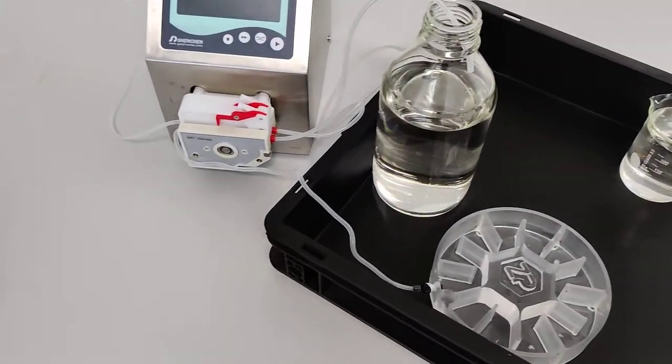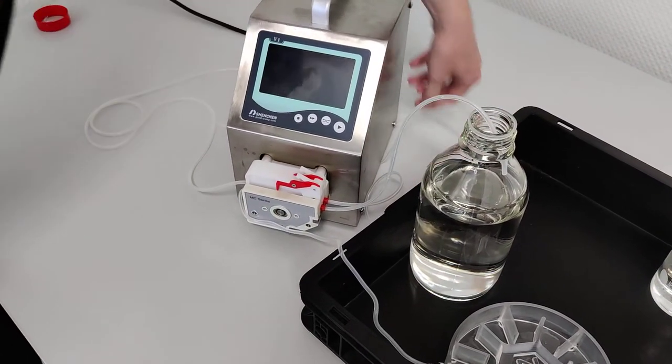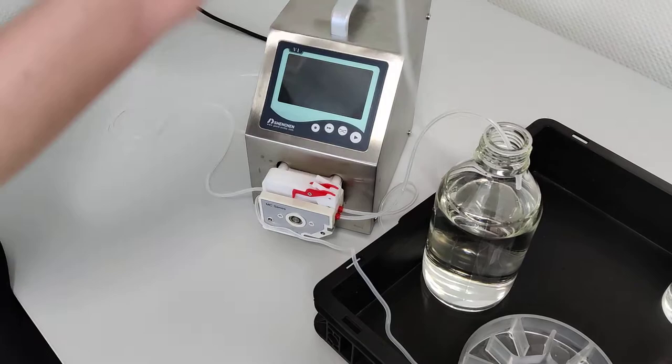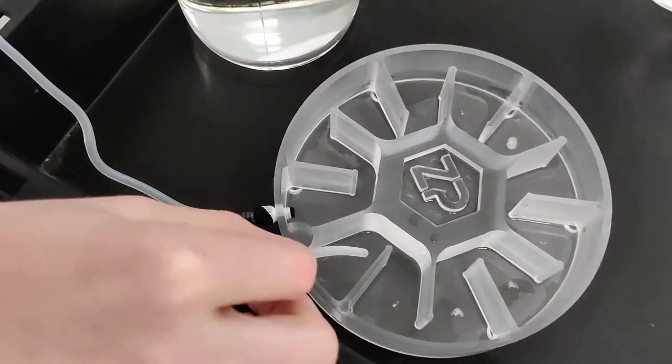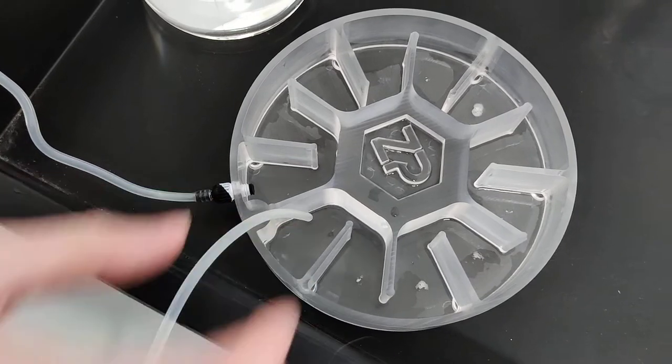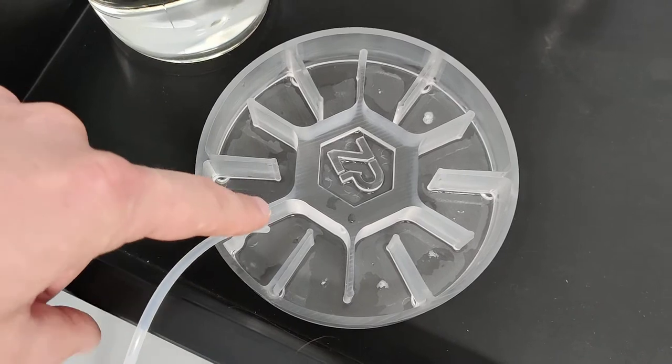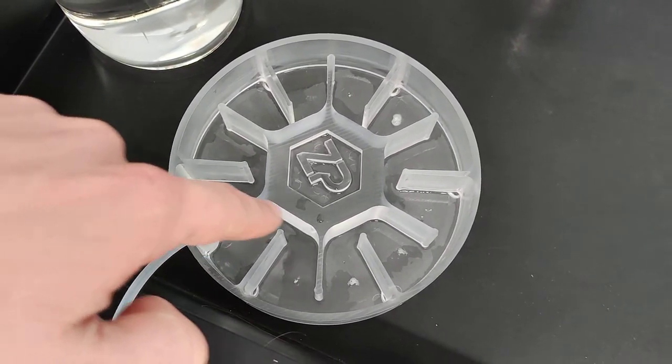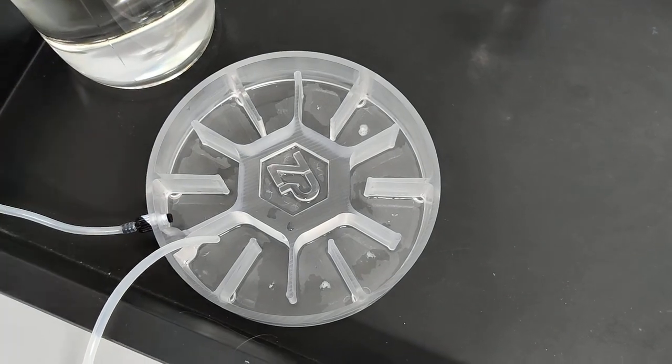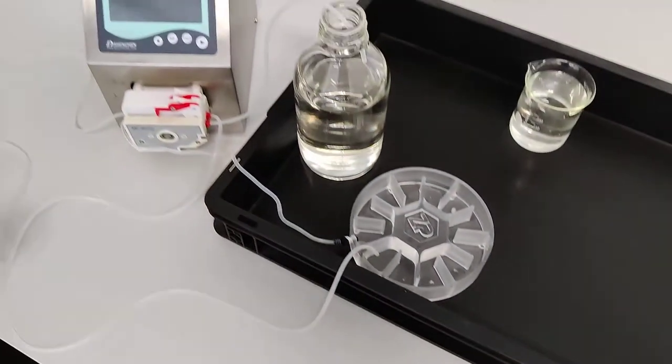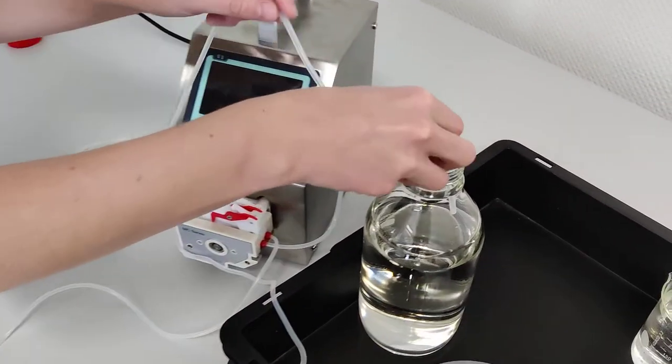For the other tubing, Anna, you can take the part first that will provide liquid out and that should be positioned in this cell here. Because as we can see there is a gate in between, so if liquid is added here, it will have to flow all the way around the flow cell before it can get extracted out.